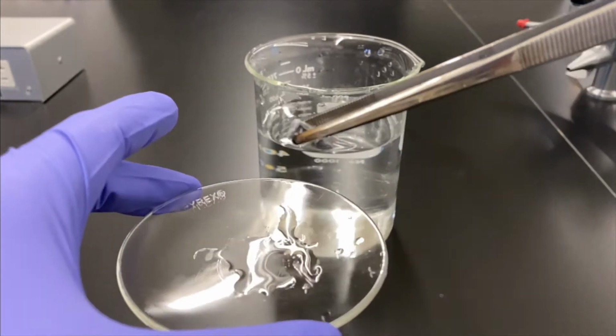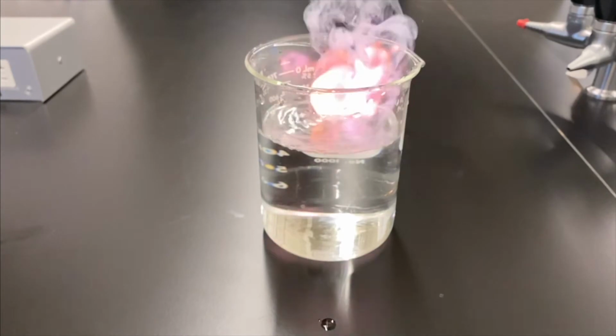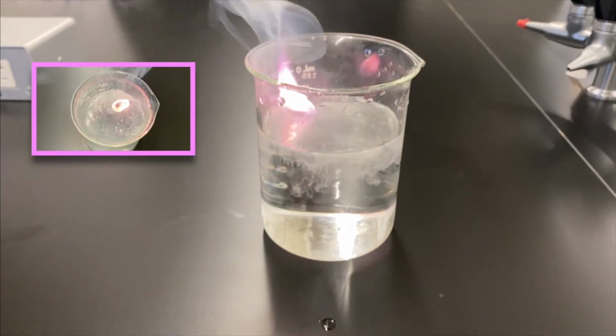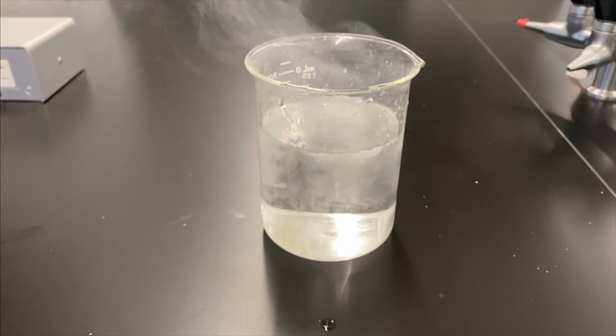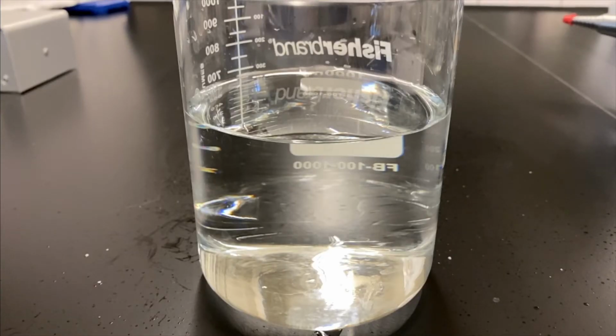All right, so we have some potassium metal. And yeah, it's on fire. It's on fire. So we have the slow motion up in the left-hand corner. Pretty cool. It's spraying out some metal chunks. Some of it got on the camera. That's okay. We'll clean it up. Now here's another replay.